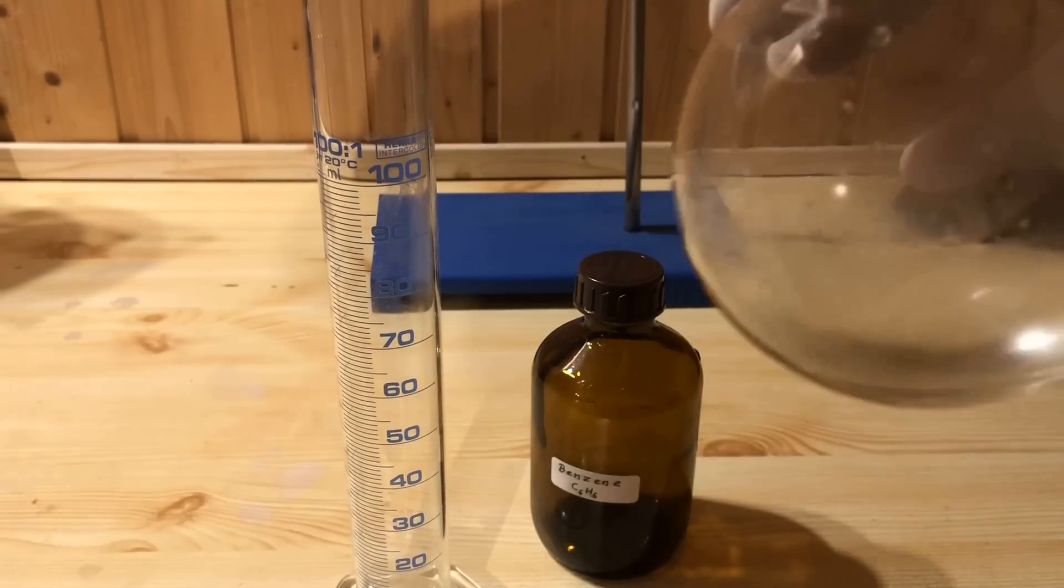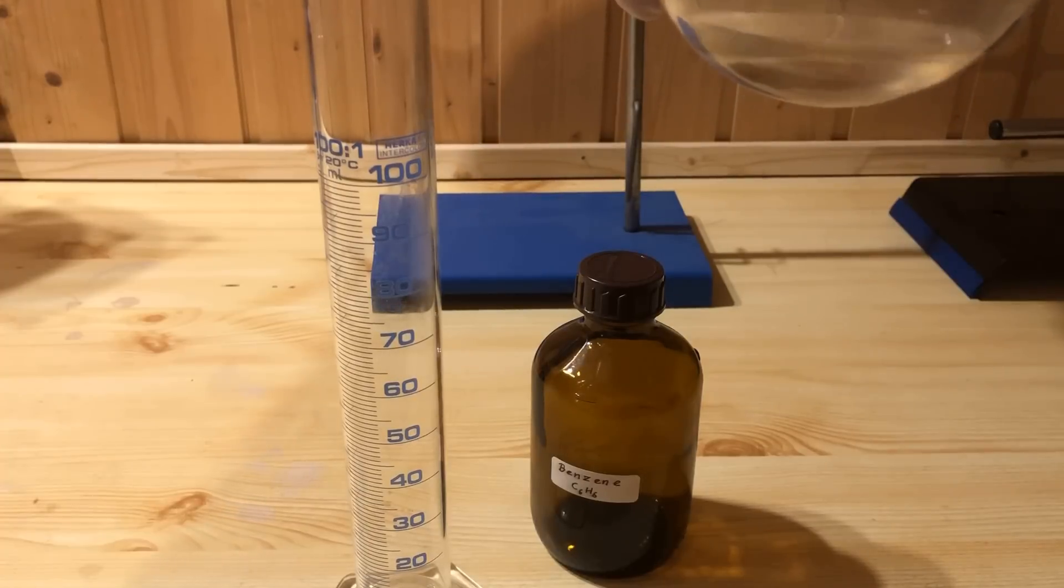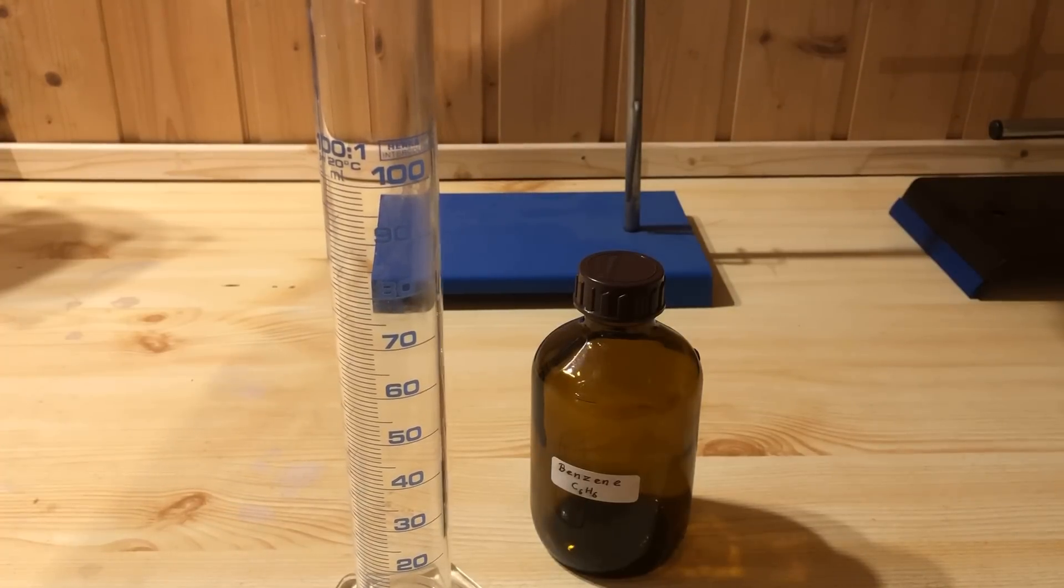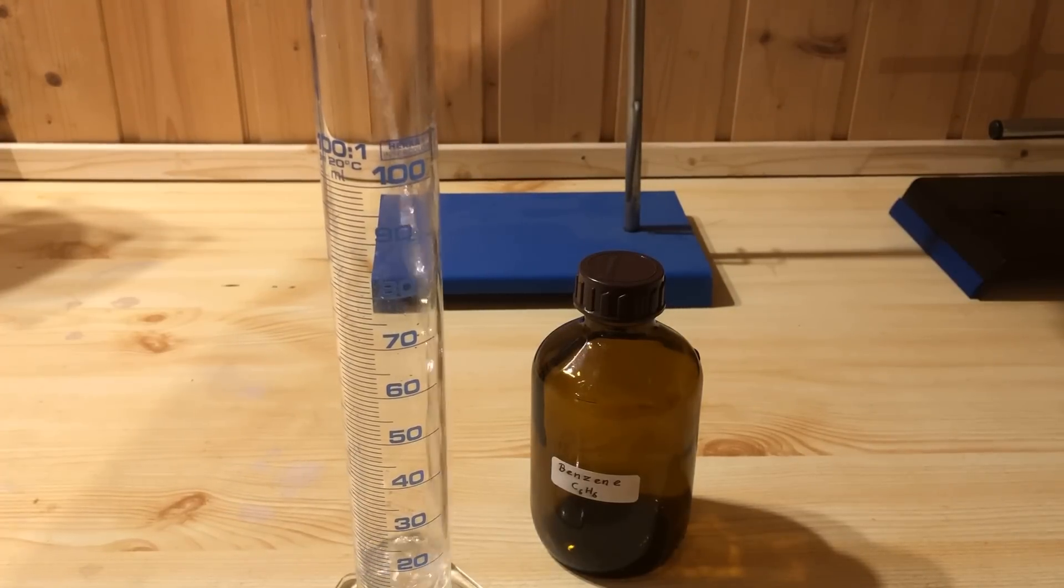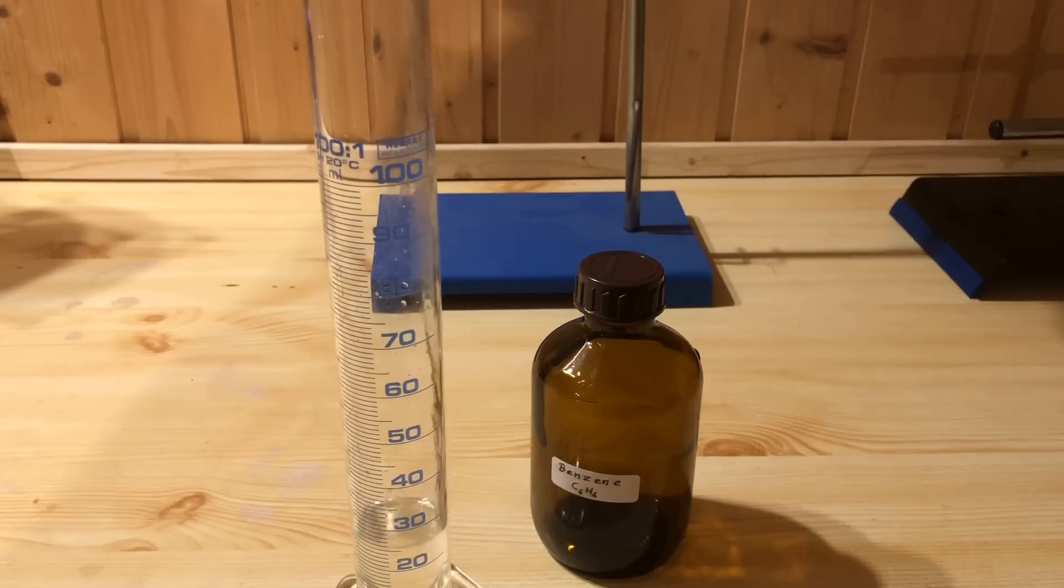In the end, the yield is 28 milliliters of benzene. The amount obtained roughly corresponds to a yield of 46%. The yield is not particularly high, but more than enough for the synthesis of lindane.